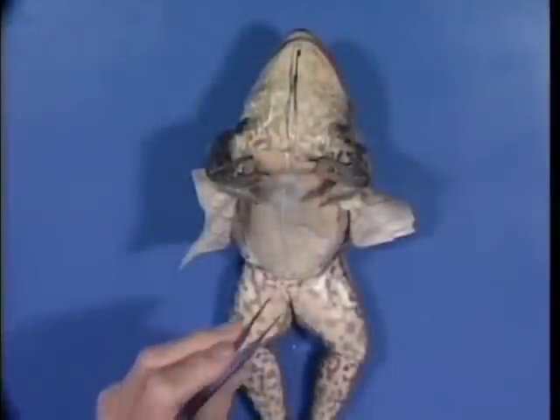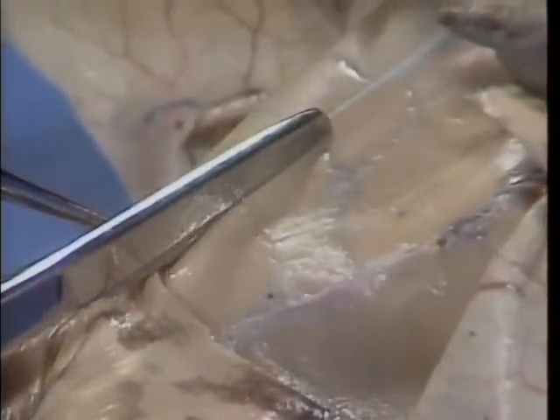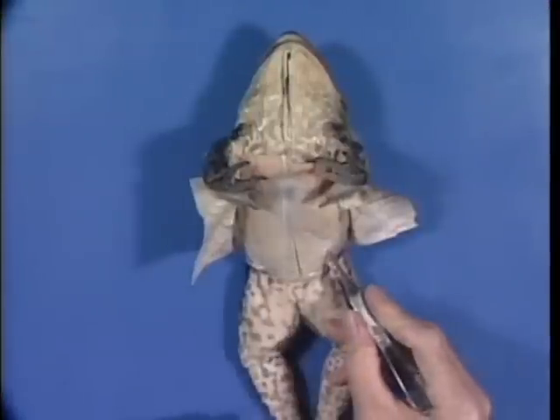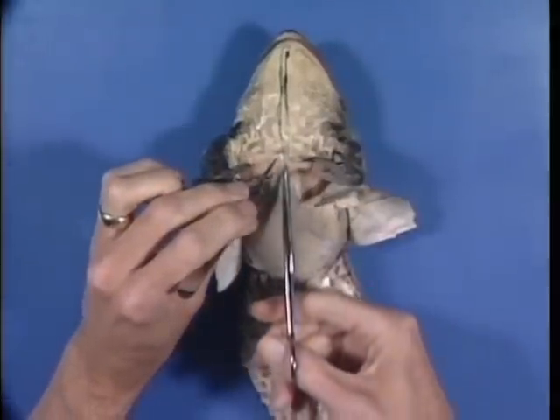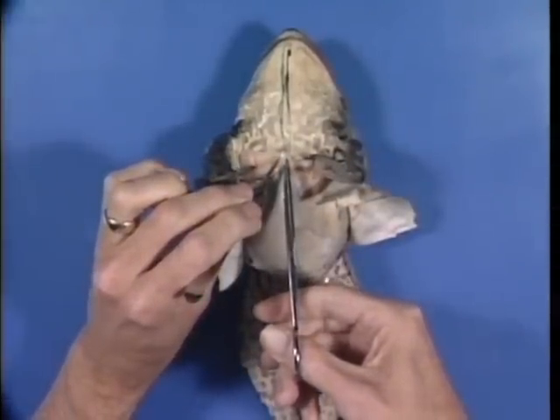In order to view the digestive system and other visceral organs, make a small incision along the midline at the posterior limit of the abdominal cavity. Then make 2 additional transverse cuts as well. Because the pectoral girdle lies in the path of the first incision, it helps to use strong scissors to cut across the girdle as the cut approaches the throat musculature.